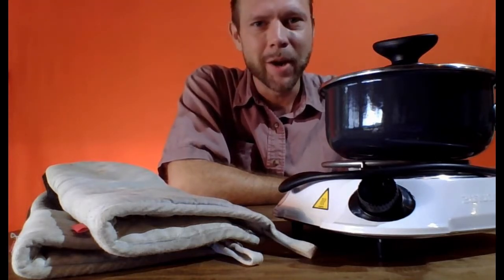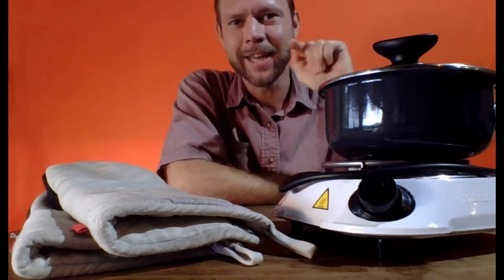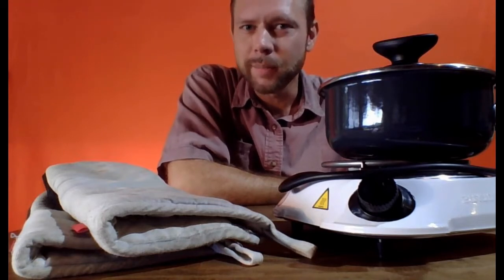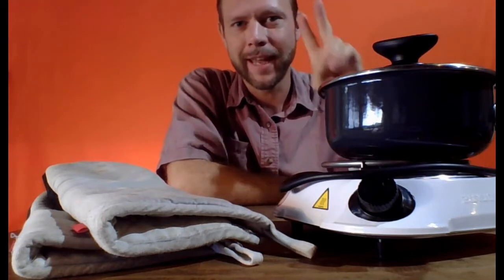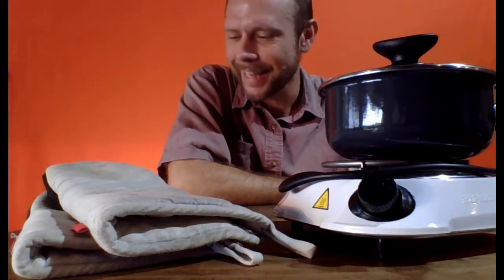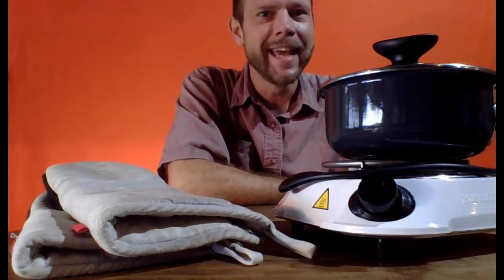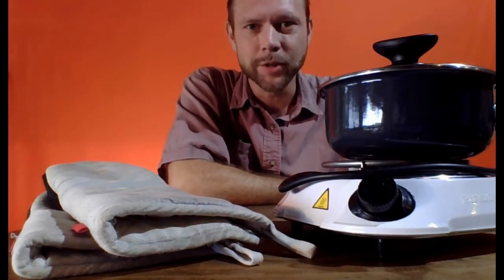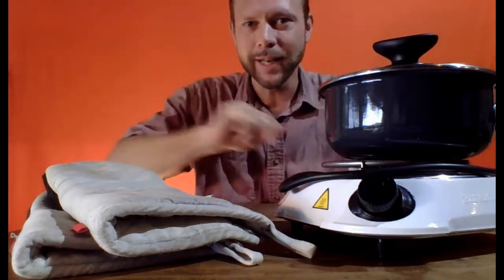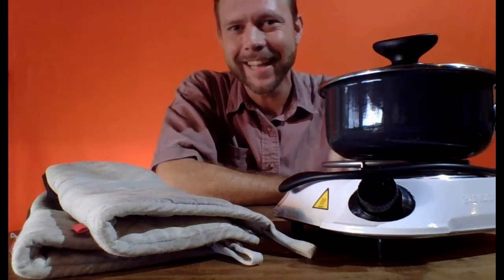And the main thing about experimenting is that you need to learn to be responsible for yourself. And being responsible for yourself in the chem lab basically has two components. First of all, you need to know what you're doing, you need to understand what you're doing. We're going to be heating something in this experiment. Do not walk into the kitchen and just start playing with fire, right? That is a bad idea.